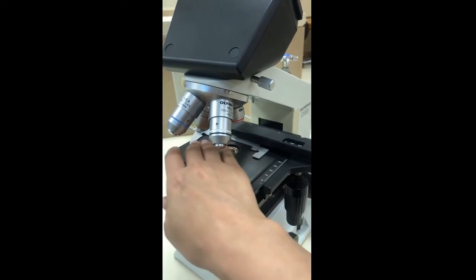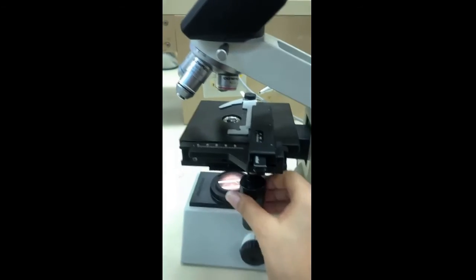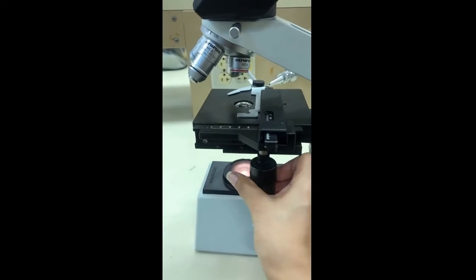Here is the stage and the stage clips. There is also a knob that we can use to move the stage up and down, right and left.